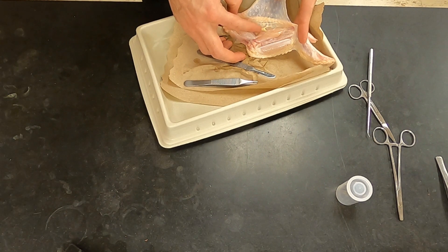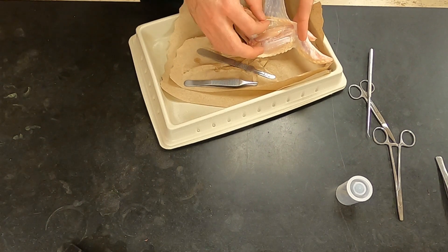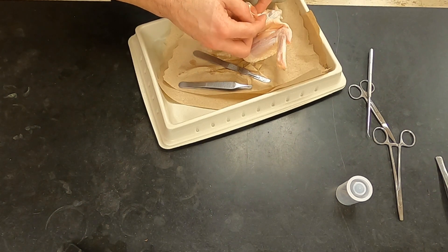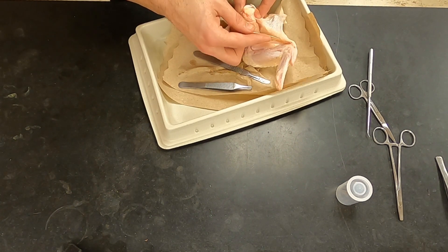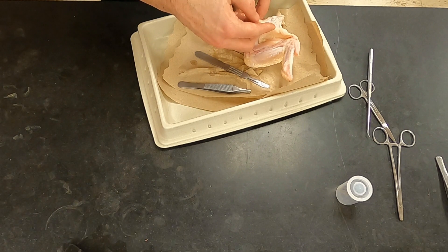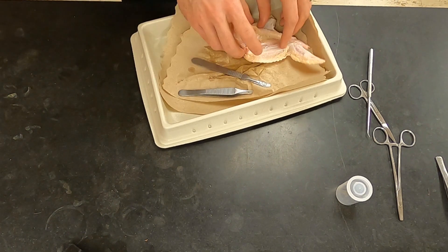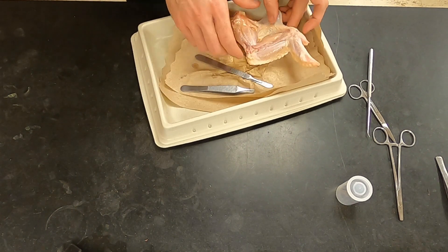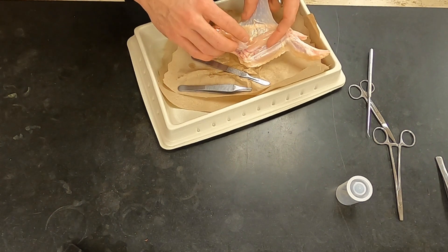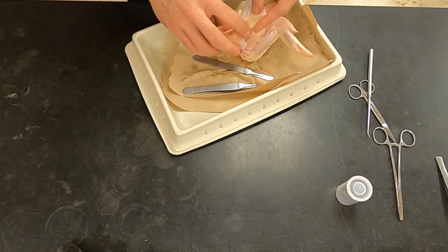As you can see, I'm able to separate the tendon away from the skin if I'm careful. The muscle tears more easily than the tendon, but you can see as you pull it what action this tendon and muscle cause — and it is to bring the wing in. A little bit of internal rotation, but also flexion of the elbow joint. Once you've realized that, you're welcome to separate the tendon and remove the skin as best as you can from the lateral side.